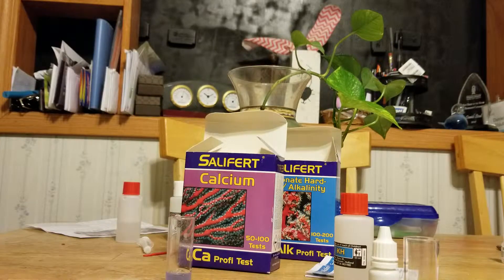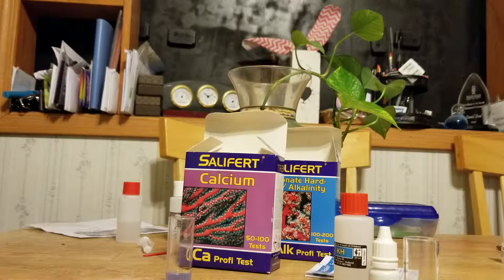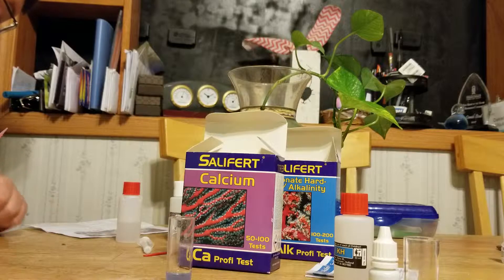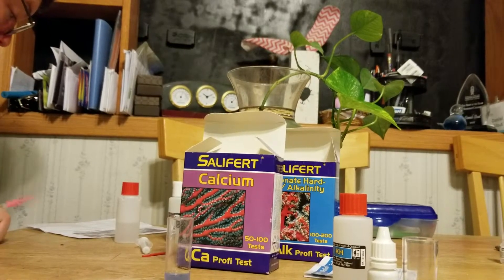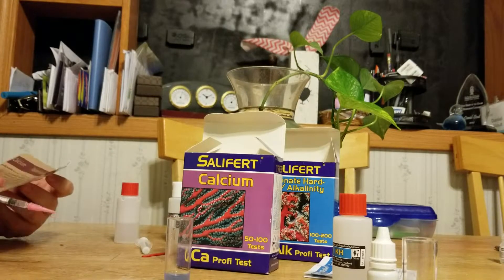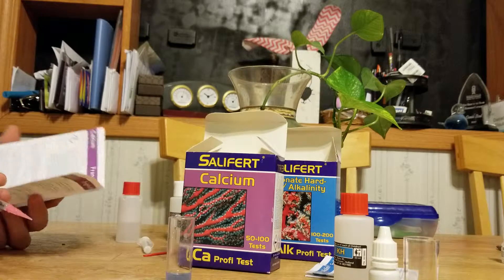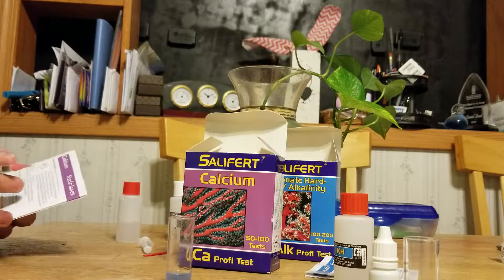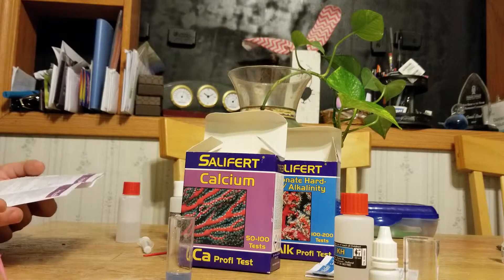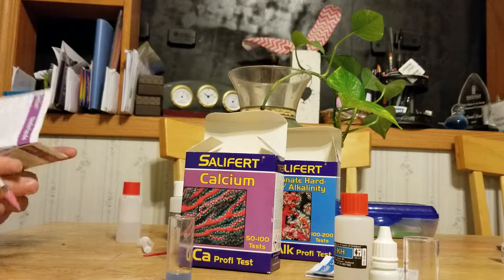We actually dropped a little more — we're at 0.16. On the scale, that's 420 ppm for calcium, which is good. It's in line where we need to be, so I'm happy with it, and we're gonna start dosing accordingly from there.